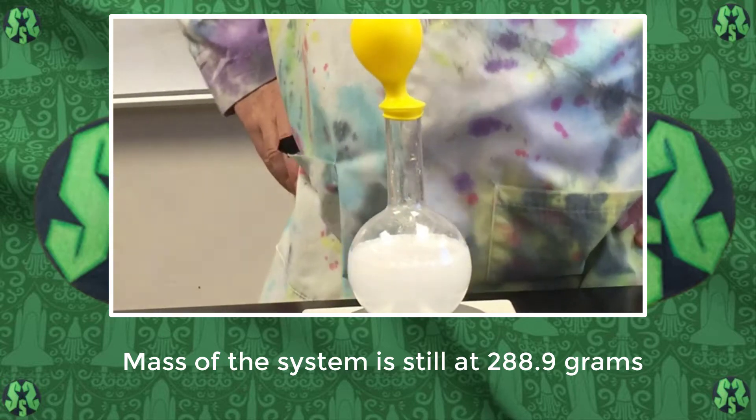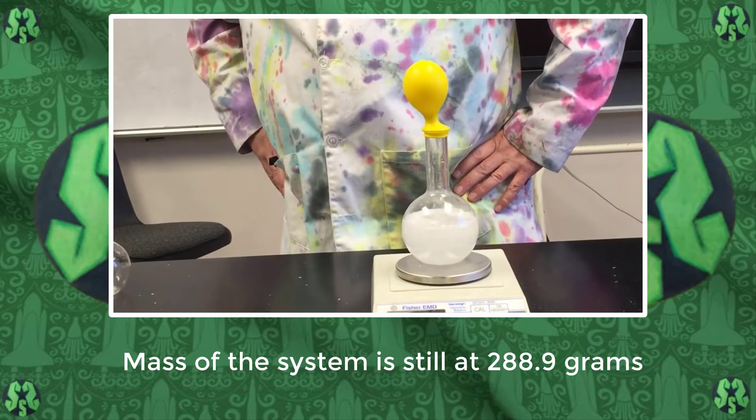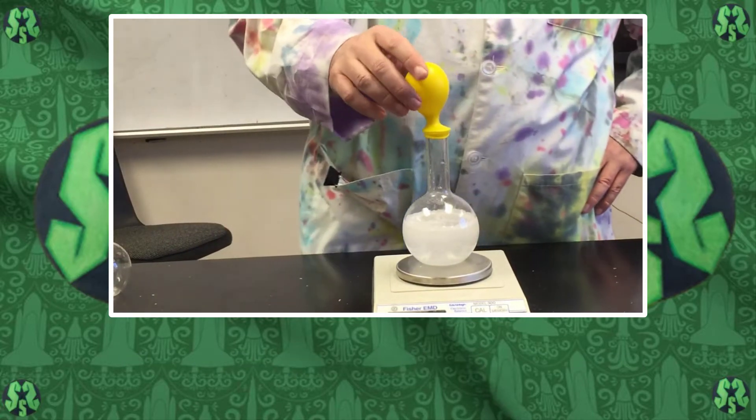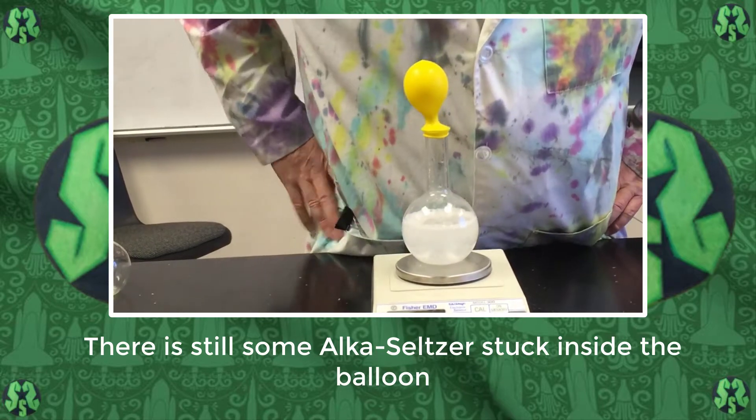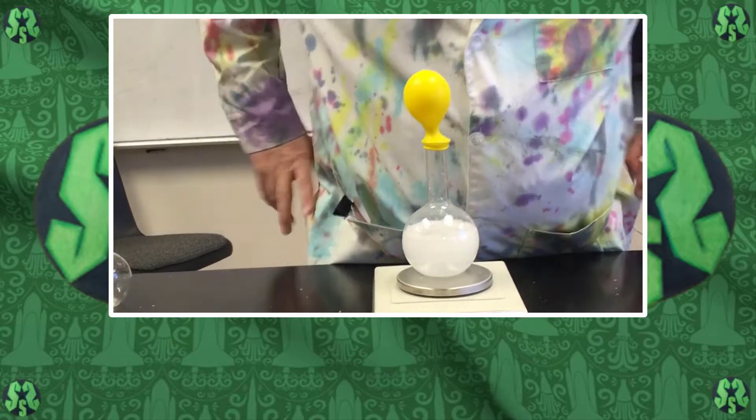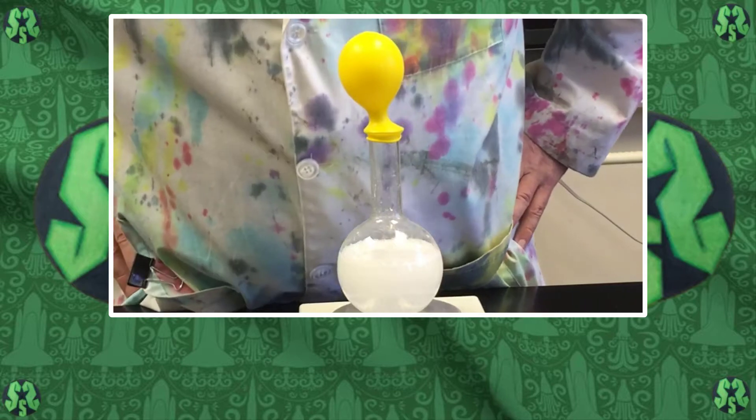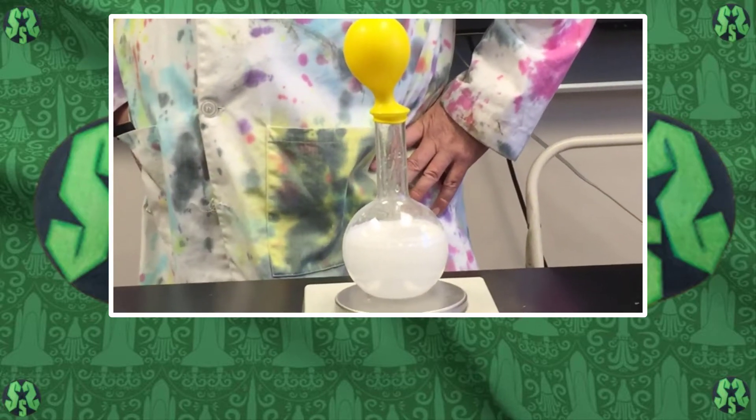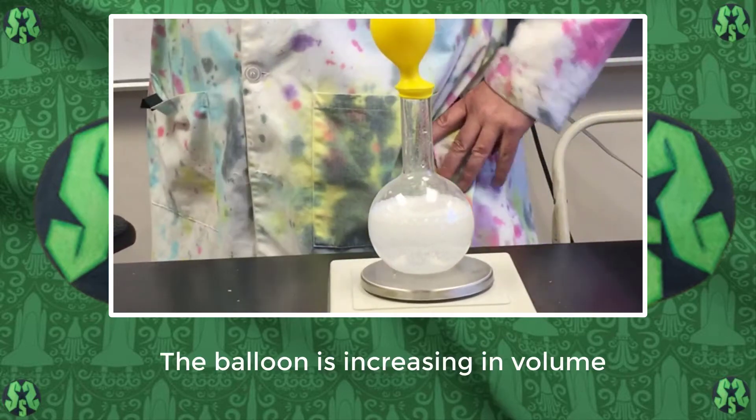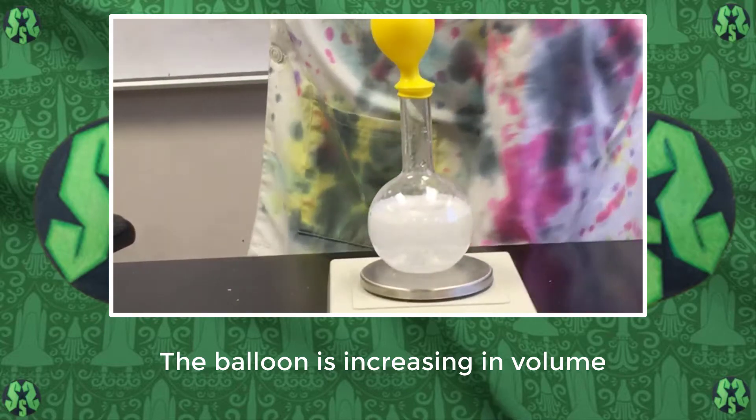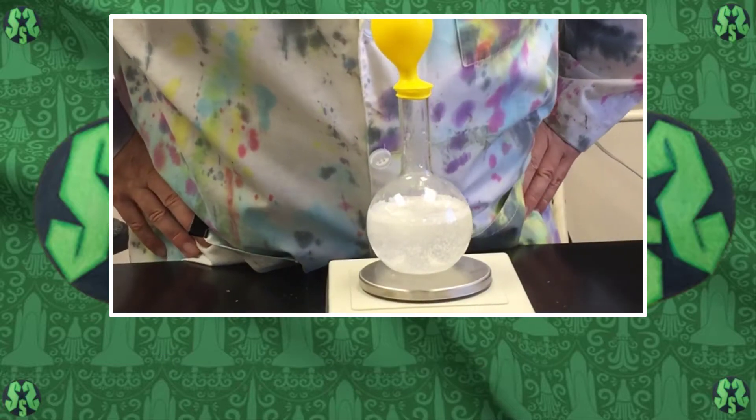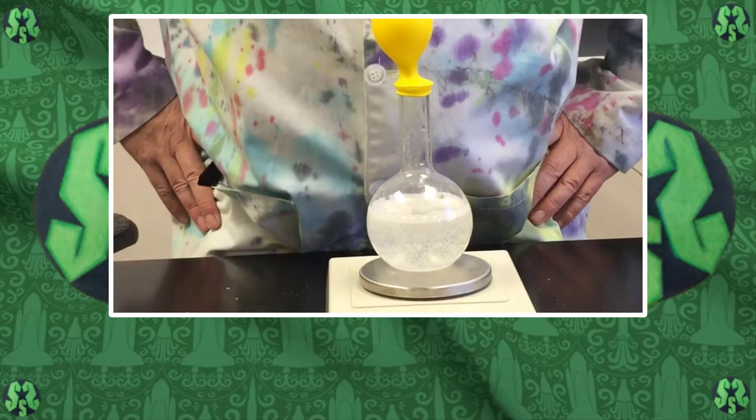It's still at 288.9 at this point. Parts are still dropping - there's parts stuck in the middle of the balloon. So that's good. And you should notice some change. What are some things you guys notice? We're gonna start seeing some decrease now.